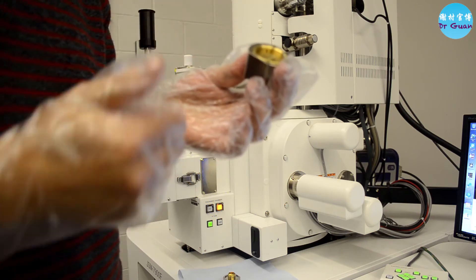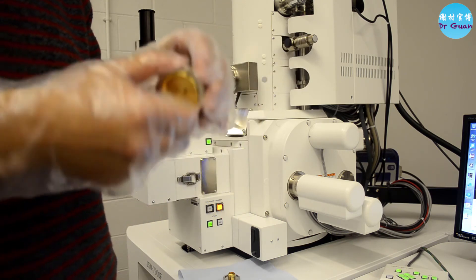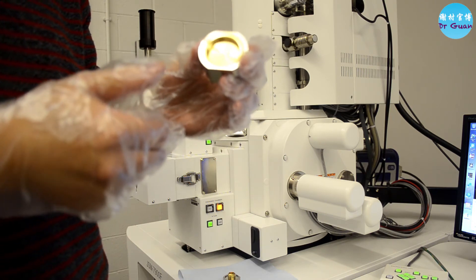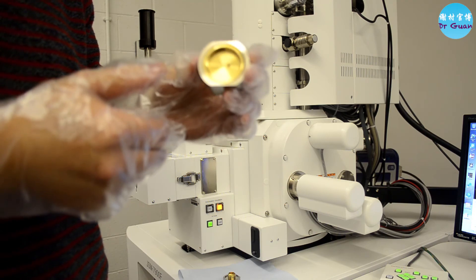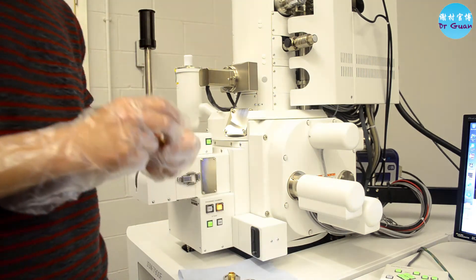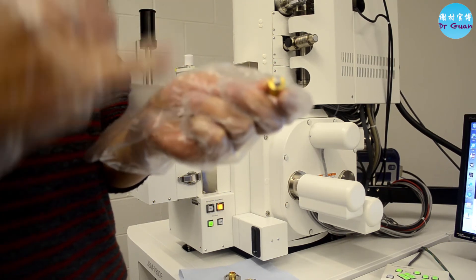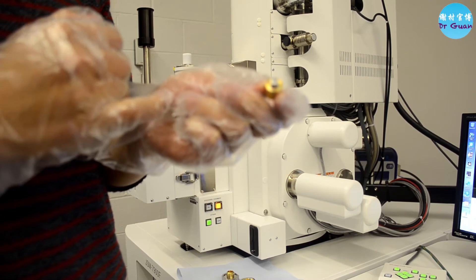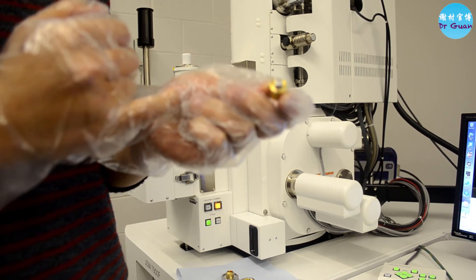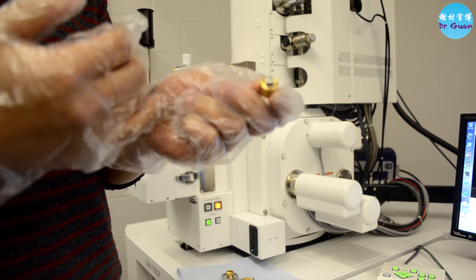Or if you can't achieve zero offset on the large holder, the maximum should be less than 5 millimeters. Otherwise, when you load your sample there may be a problem — the sample could touch the pole piece inside the SEM, which would definitely be a disaster. Another suggestion: when sticking your sample for EBSD runs, it's better to use silver paste to attach your sample. This will help avoid beam drifting or image drifting during SEM scanning.